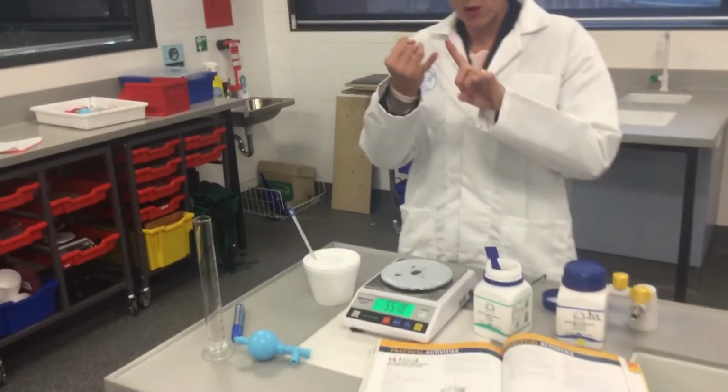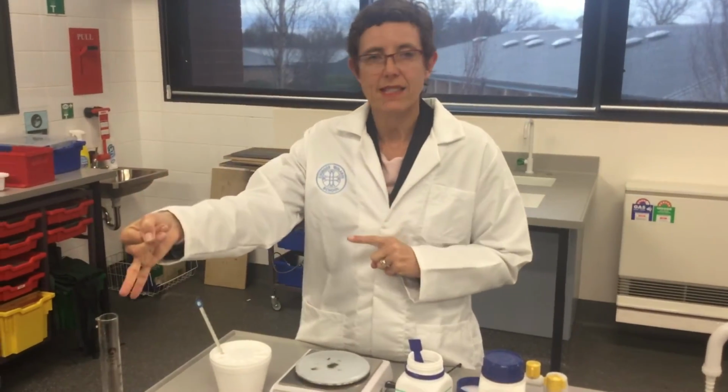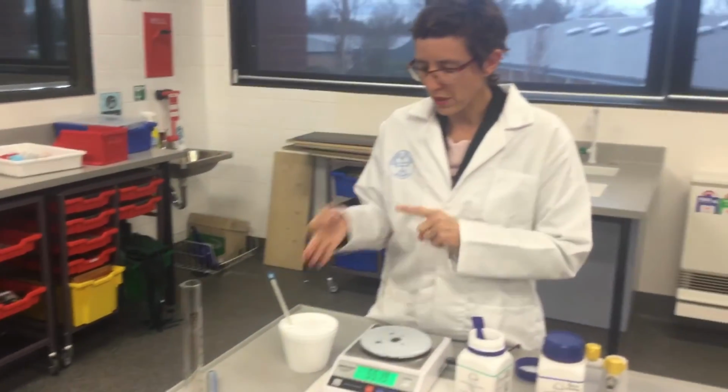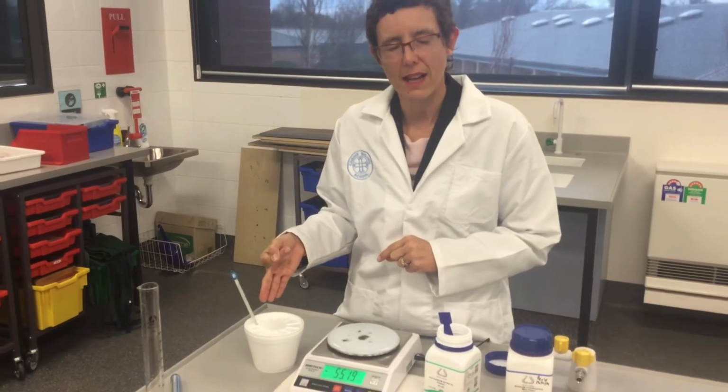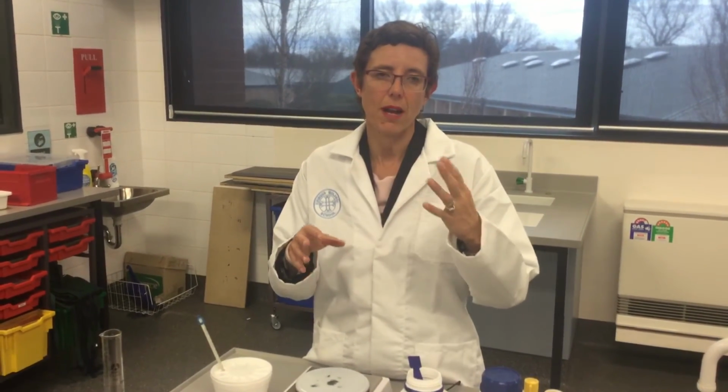So I've recorded my mass of solute, I've recorded my mass of solvent, I've recorded the initial temperature, and then I've recorded the final temperature. Then I put it into my formula.